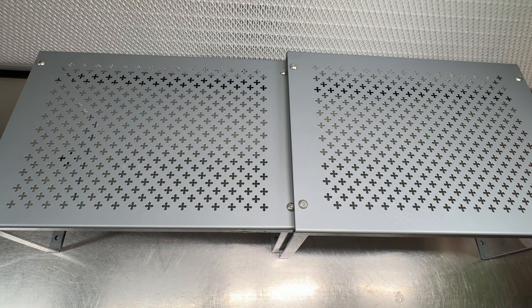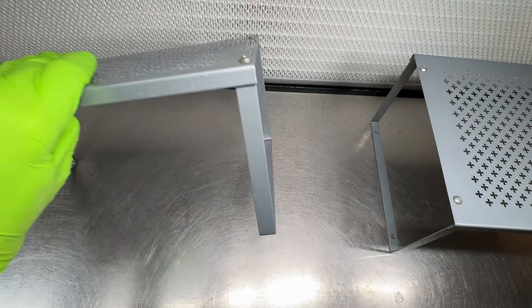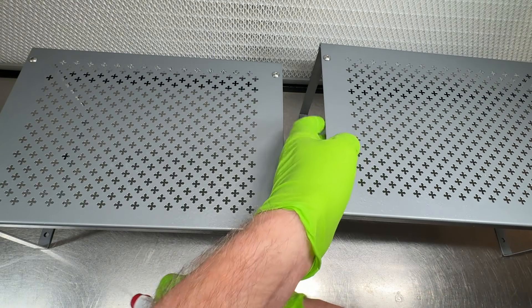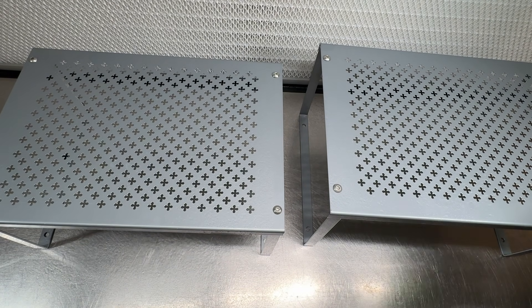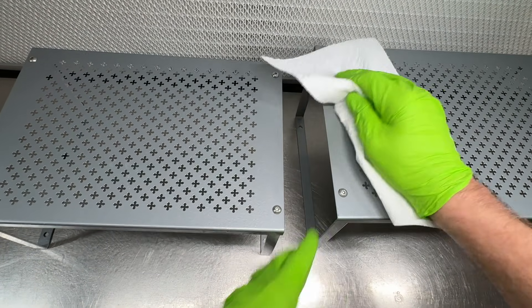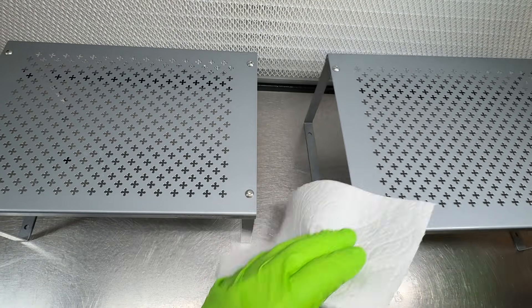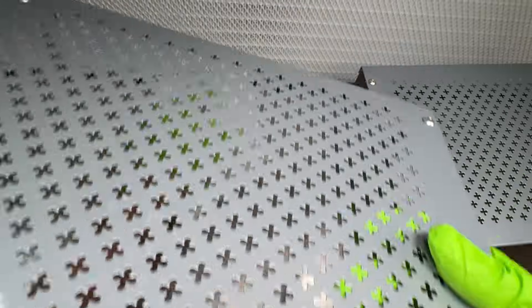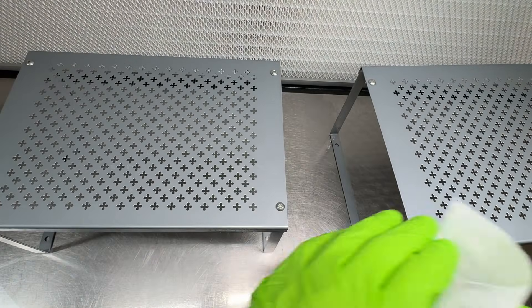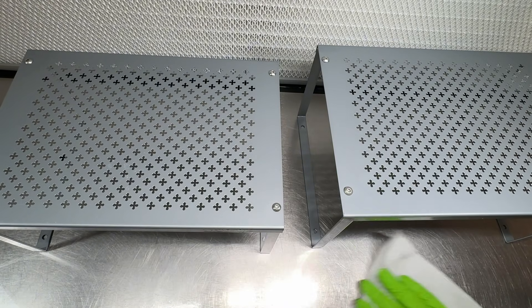Many of you had wanted a quick walkthrough video of reconstituting peptides, then filtering. Several people asked about venting. We're getting ready to make some kits to send out. The goal of this whole process is to make sure that we filter and make everything as clean as possible that goes into your final reconstituted sterile vial, so good aseptic technique is important.